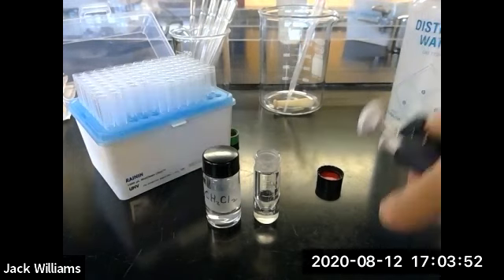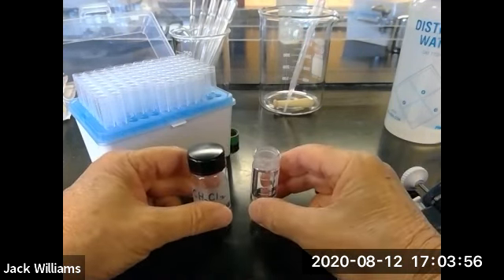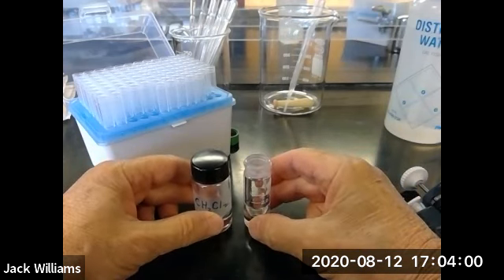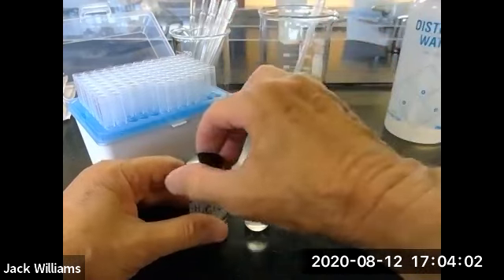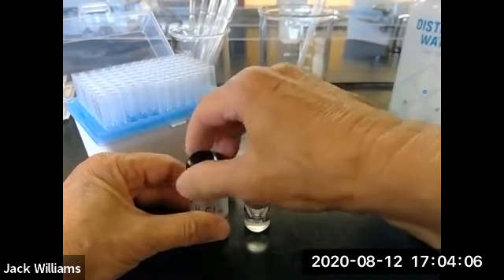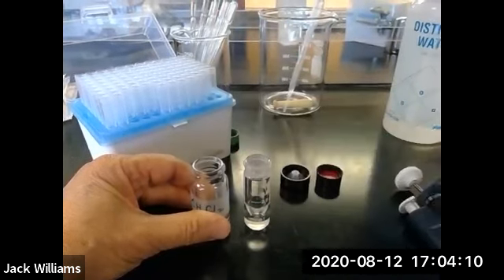So we're ready to take the sample out. The pipette is set for 600 microliters. You have your methylene dichloride next to your conical vial with the benzoic acid. So wearing gloves, and I'm not wearing gloves, but I'm trying to do this and it's all backwards. So if I was wearing gloves, I'd really have a problem.